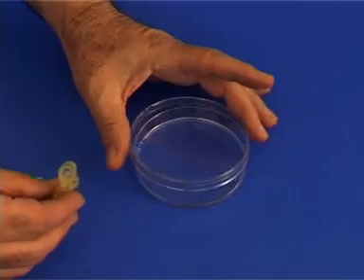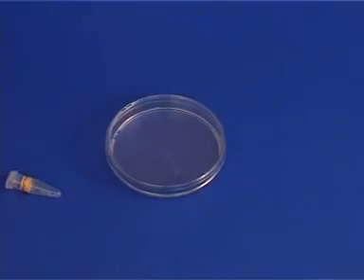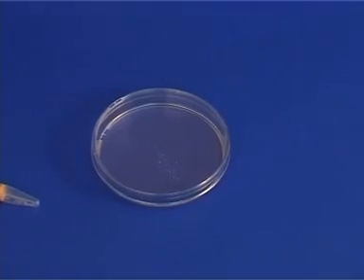Add a few sodium chloride crystals into the solution. Note that there is no change in the solution and the crystals are just floating in the solution.